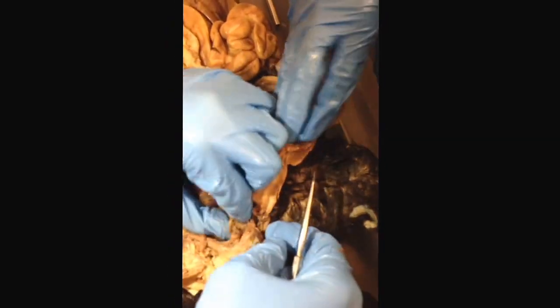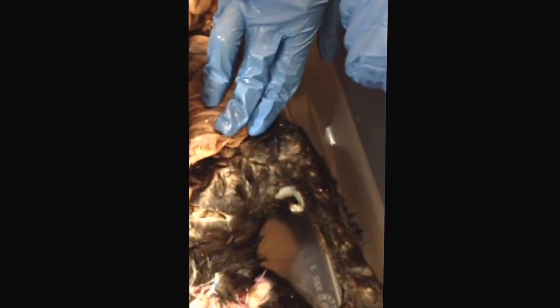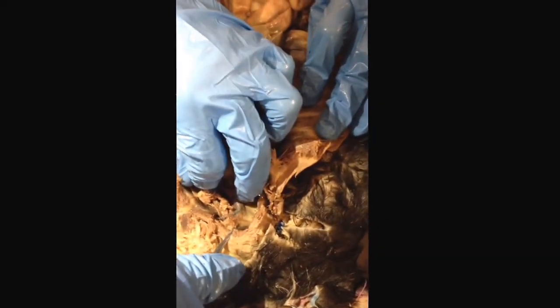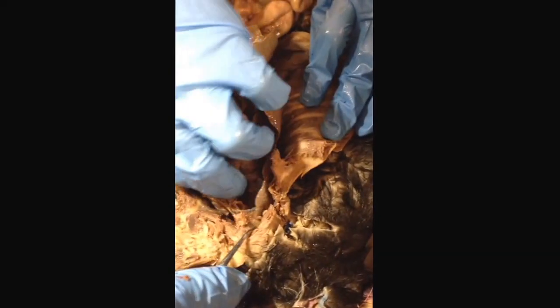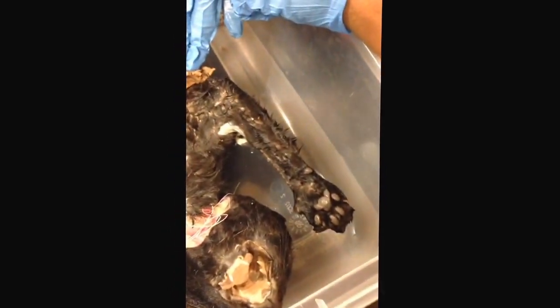The next thing on the list is the trachea. I believe that for the test, it'll be cut a little bit closer to the head. But the trachea is somewhere in there. It's basically the tube that leads from the esophagus and the mouth to the lungs. Good. Next thing on the list is the horn of the uterus, I believe.